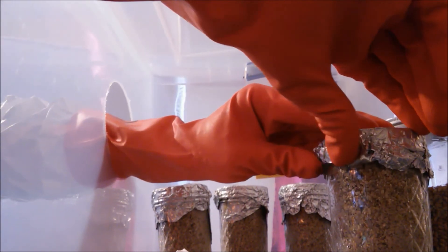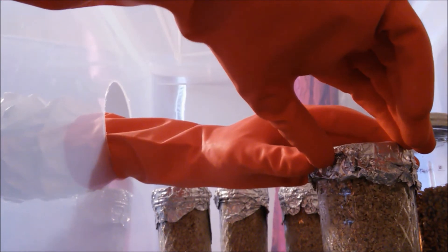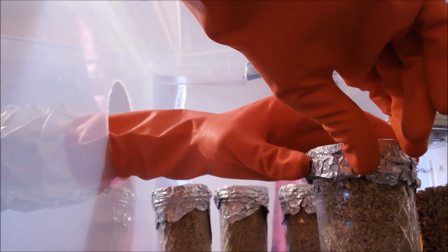If you see anything that's not white, any other colors like green or pink or black, toss it out without opening the jar.